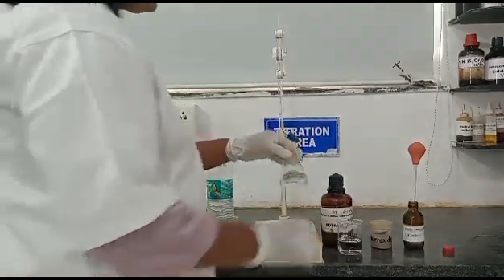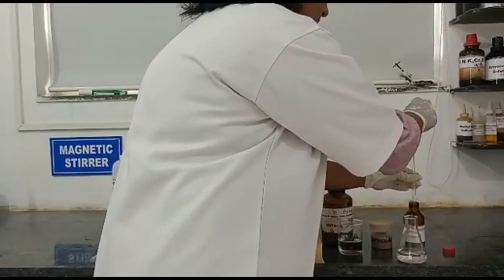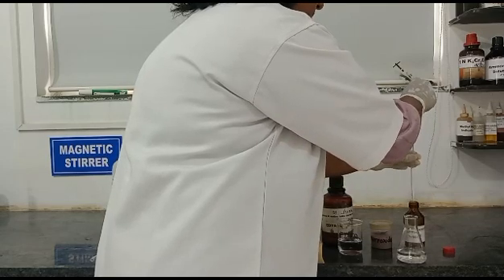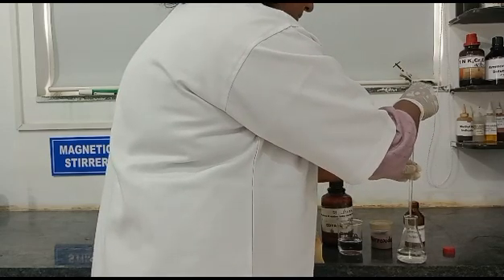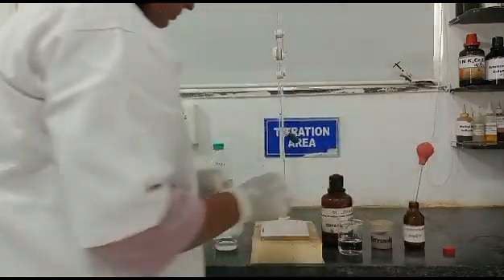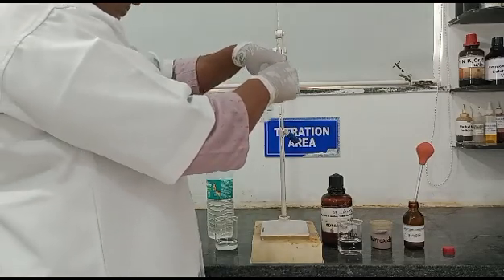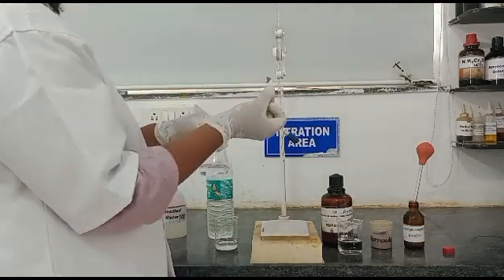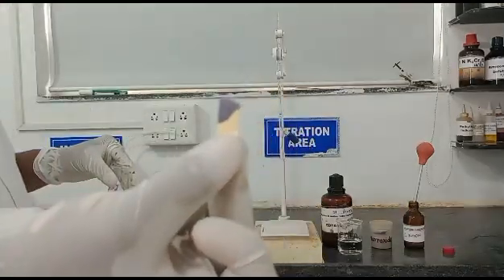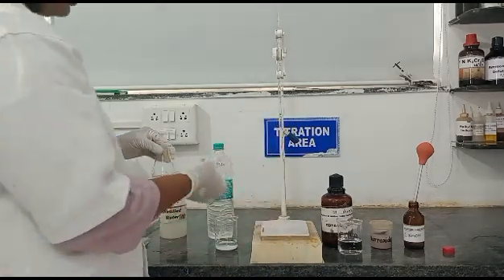Now we will add 1N NaOH to make the pH of the sample around 12 to 13. We have added 1N NaOH and will check whether pH 12 is attained or not — this will be done by pH paper strip. You can see the colour change of the pH paper, which confirms that pH 12 is attained.